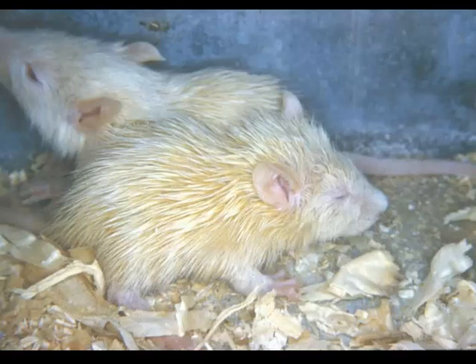While not specific, this appearance of the quote-unquote greasy mouse is suggestive of infection with mouse reovirus type 3. They get this greasy appearance because of the steatorrhea and diarrhea, and as they clean themselves, they get this diarrhea and all the fat that is not digested into their fur, giving them this sticky appearance, although you can see the same thing with rotavirus in young mice as well.